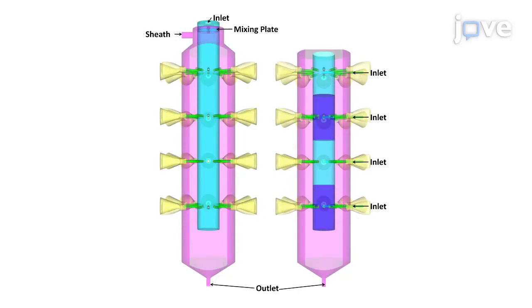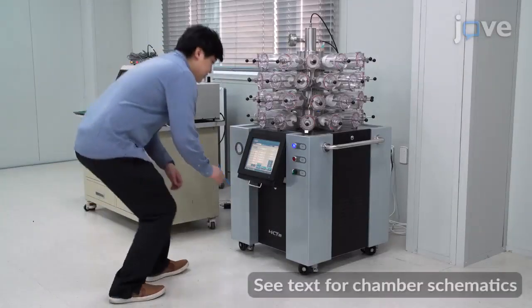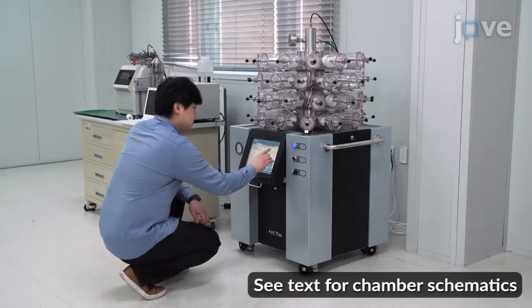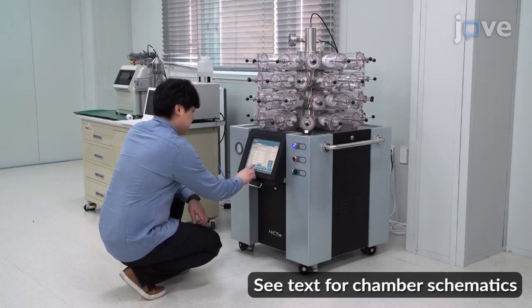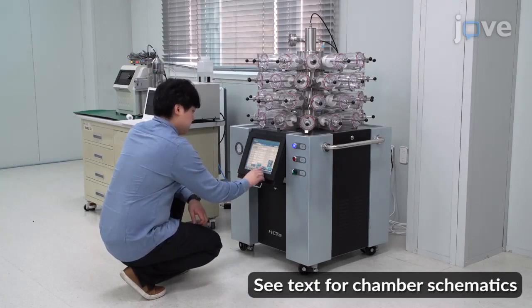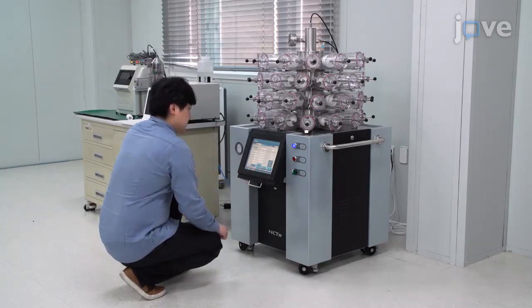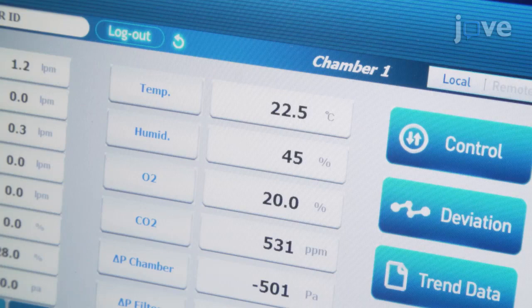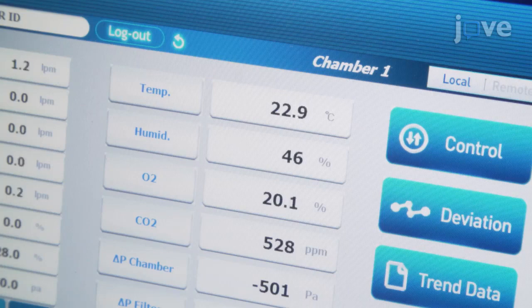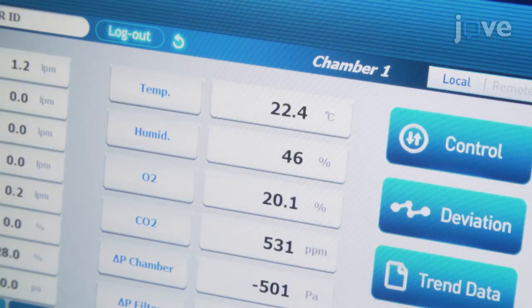To begin testing a single concentration chamber, seal the chamber and check it for leaks at 500 and negative 500 pascals gauge for 30 minutes each. Then set the clean air temperature to 23 degrees Celsius and 45% relative humidity.